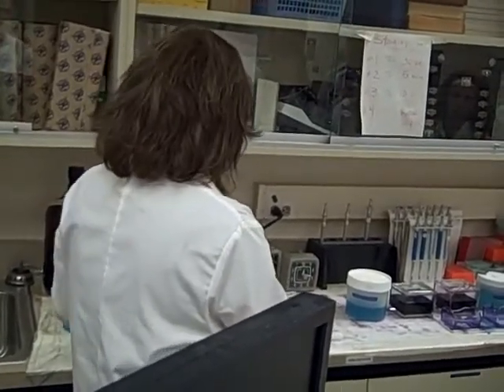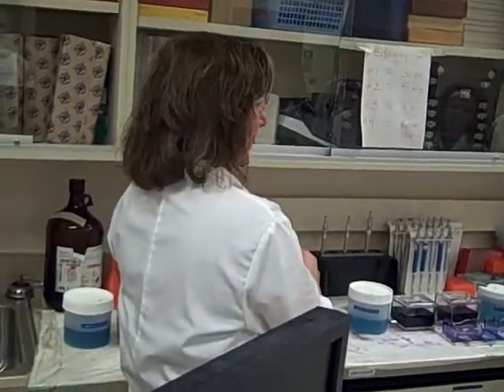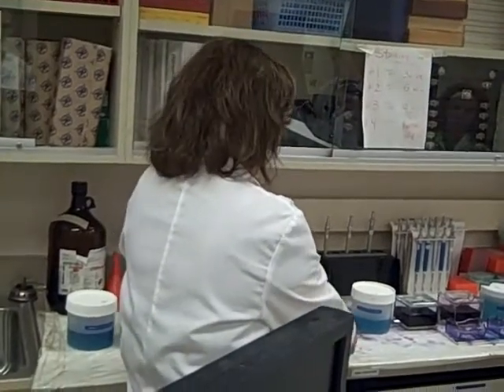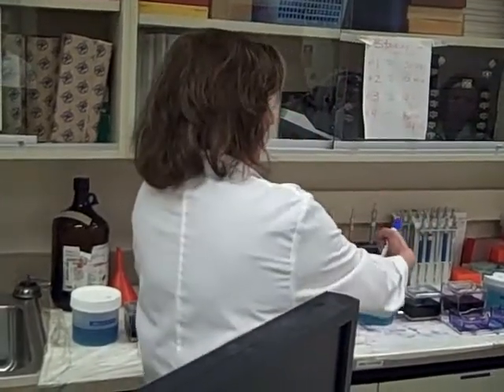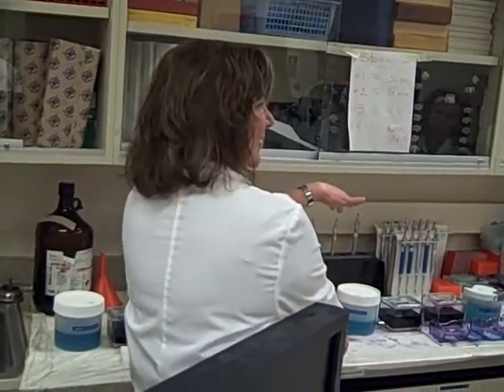After that, blot and then you just rinse and dip like 10 times. You're going to take your slides out of the boat and put them in your drying racks. You're going to want to put the frosted end down in the drying racks — don't put them perpendicular, put them long-wise with the frosted end down.